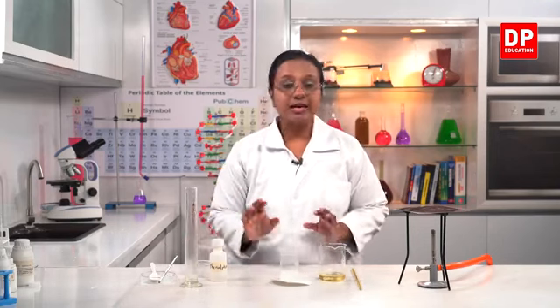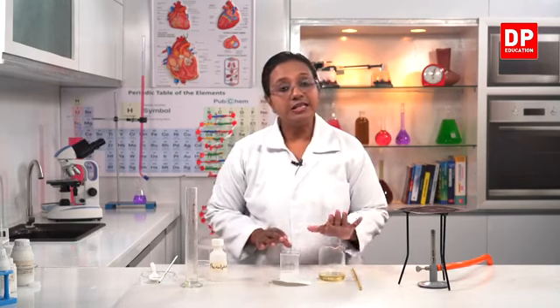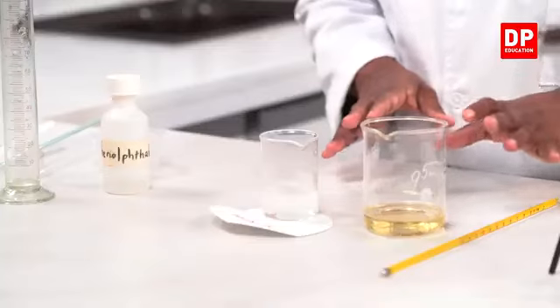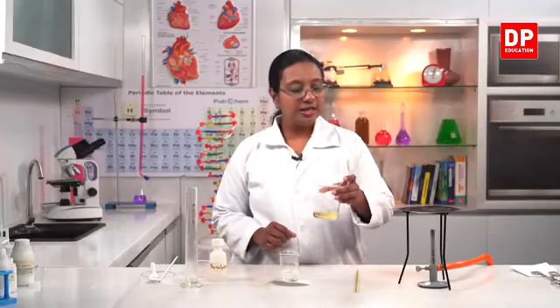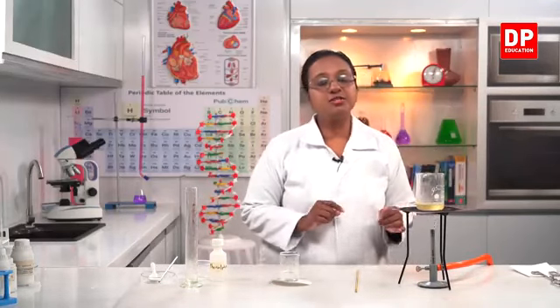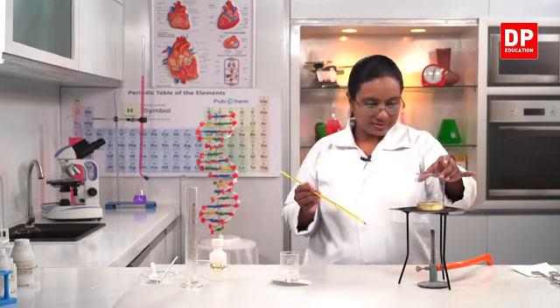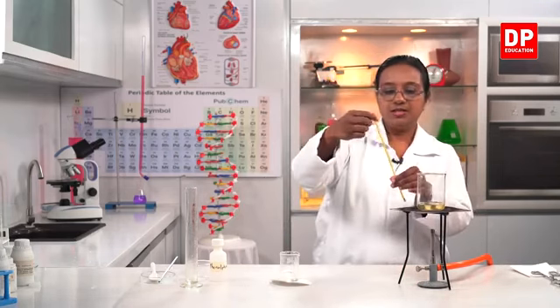So, now that I have the sodium hydroxide solution ready, I have to heat this oil to 70 degrees Celsius. That is what I am going to do next. We don't boil it, we don't bring it to the boiling point, but we heat it to 70 degrees Celsius. I have the coconut oil in a 250 milliliter beaker because it will be easy to transfer the sodium hydroxide and mix it well. So, now you can see the burner.